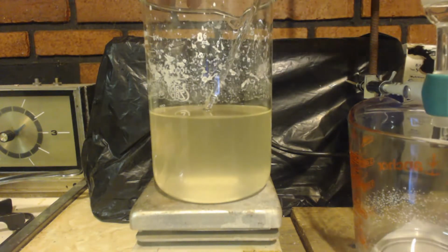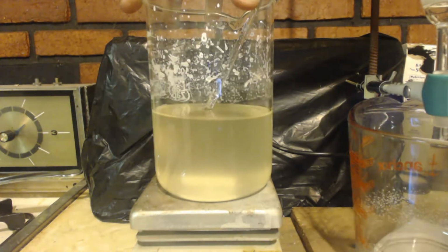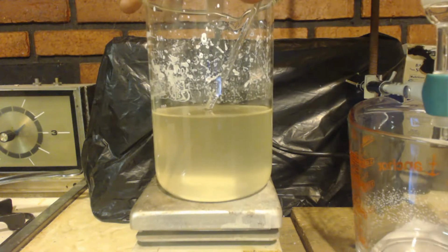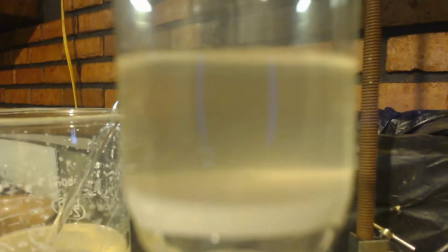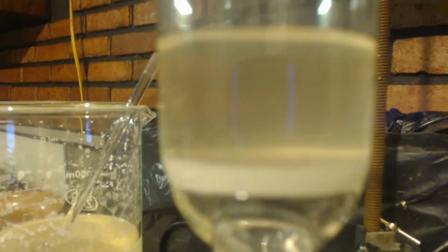It's been like an hour or something. This just won't dissolve. It's kind of cloudy. It's making it look all discolored. So as you can see, I'm filtering it little by little. It's coming down there. You can see how clear it is now. It's cloudy and makes it look yellowish, brownish. It looks like dirty water, or like something isn't dissolved all the way. So maybe there's an impurity, maybe I'm not using enough water. Either way, it's coming out clear. It's very little, so I could care less if I lose it.